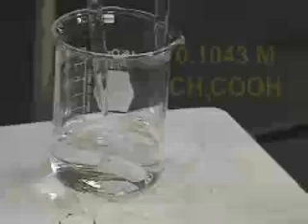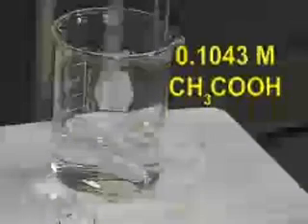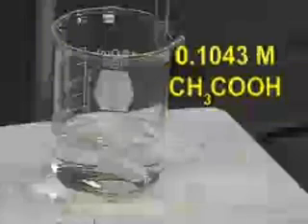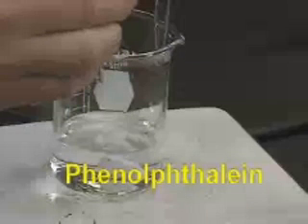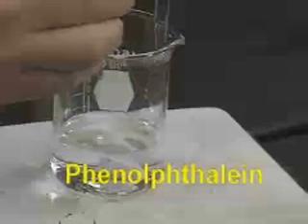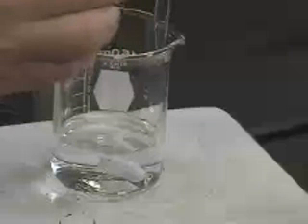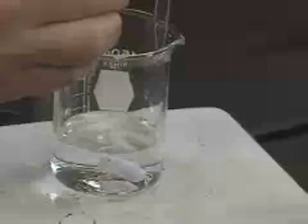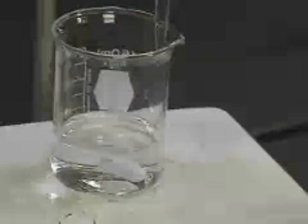We're going to pipette 50 milliliters of the acetic acid solution into the beaker. We're going to add three or four drops of phenolphthalein indicator to the solution. Phenolphthalein is an acid-base indicator — it is colorless in acidic solution and pink in basic solution. It changes around pH 9 to 10.